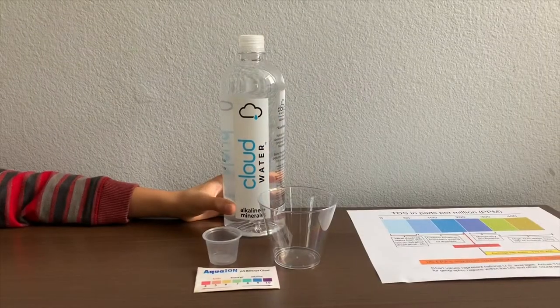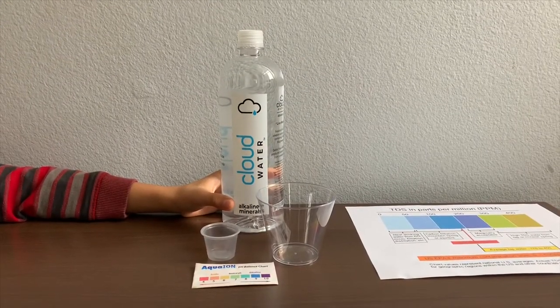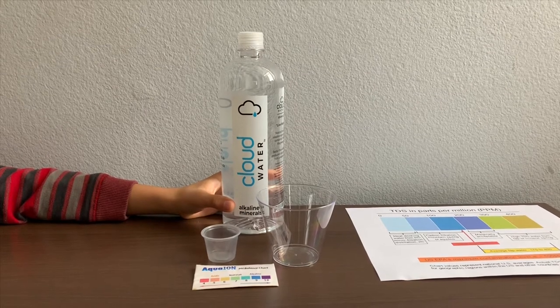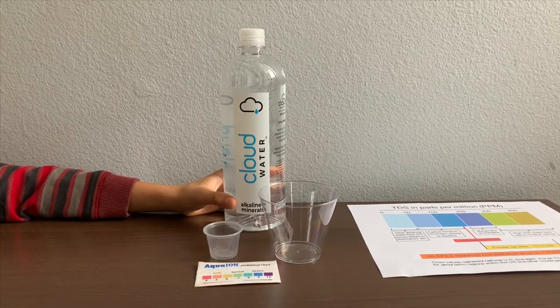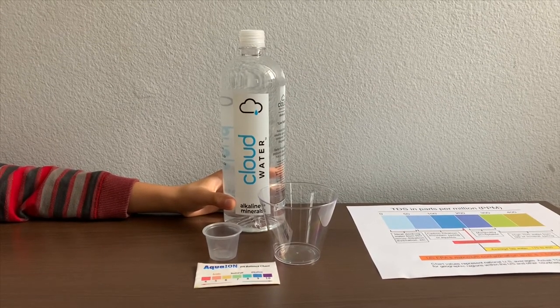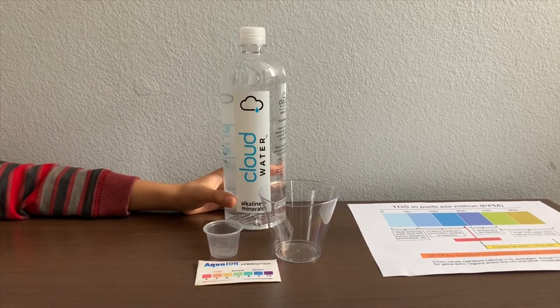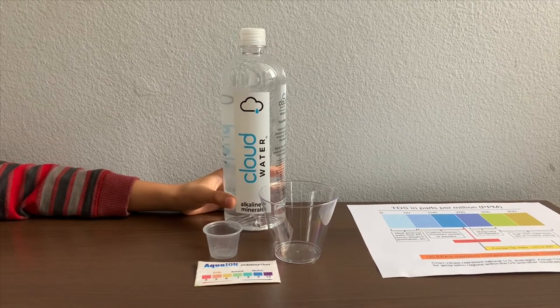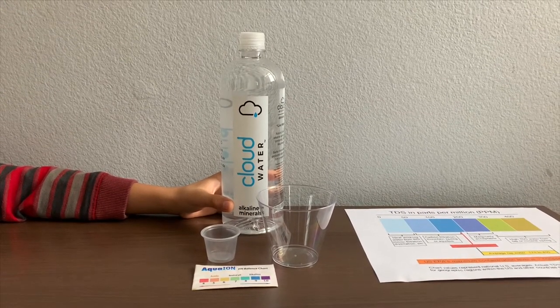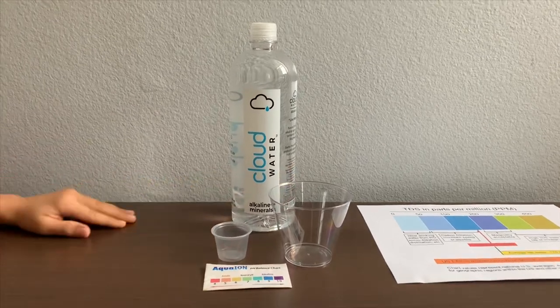This is Cloud alkaline spring water containing natural magnesium. Cloud water is sourced from Adobe Springs, California. The pH balance in this water is supposed to be 8.6. Let's test the pH and TDS levels.